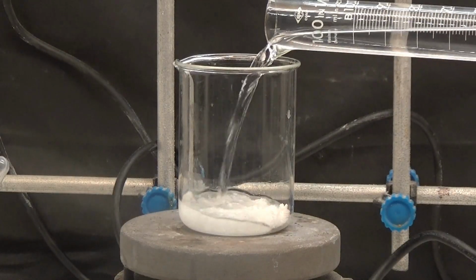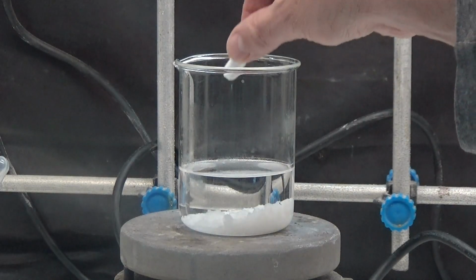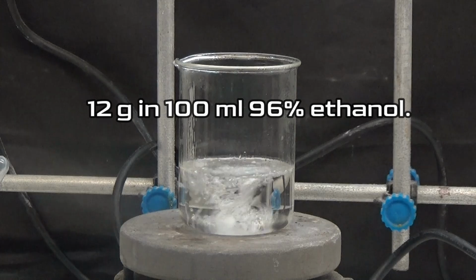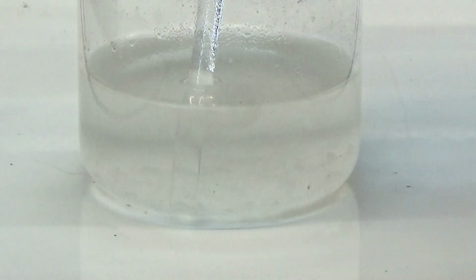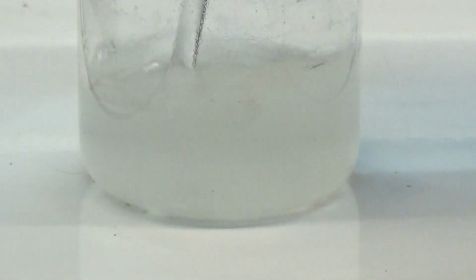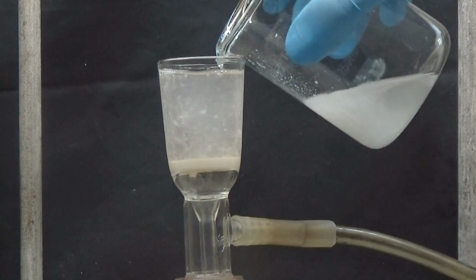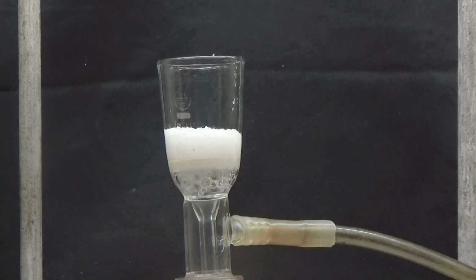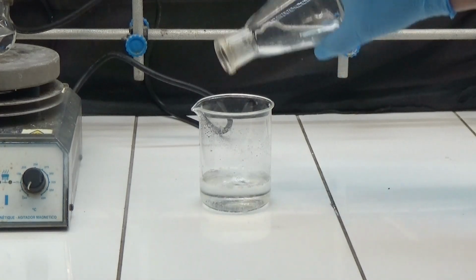To purify the uridoacetate we are going to recrystallize it in hot ethanol. Dilute all the product obtained, about 12 grams, in 100 milliliters of 96% ethanol. It was left to cool overnight and some transparent crystals appeared. A small amount was obtained. Collect the crystals by suction. The filtered liquid was evaporated to 1/3 of its volume and allowed to cool to crystallize overnight.